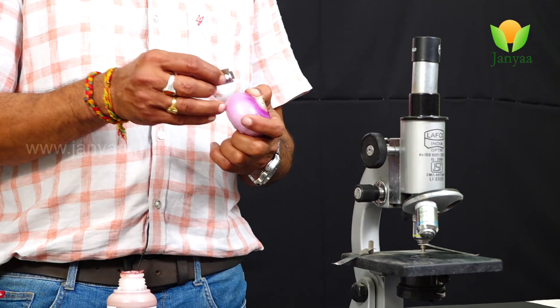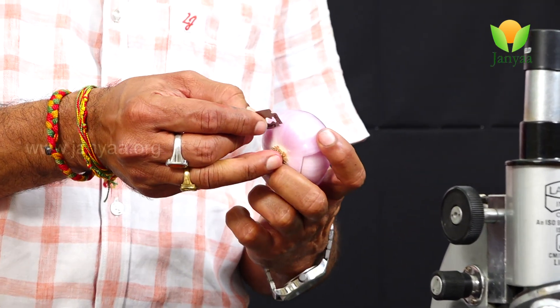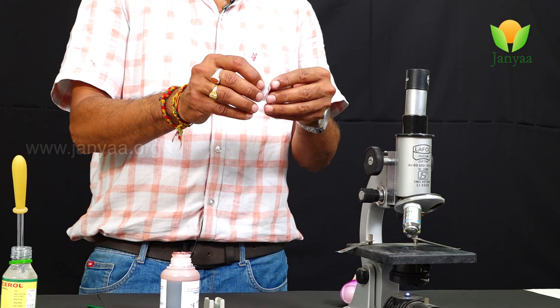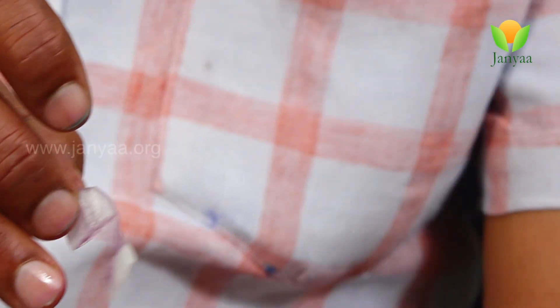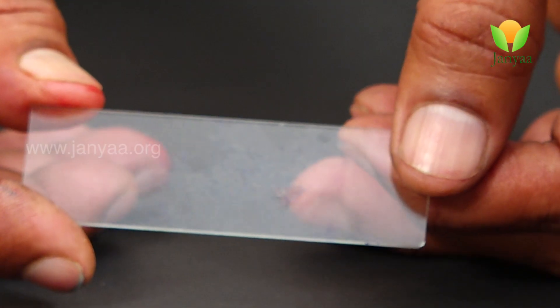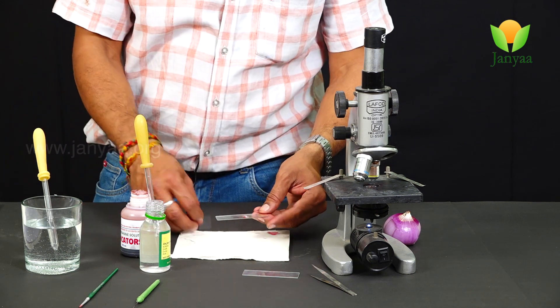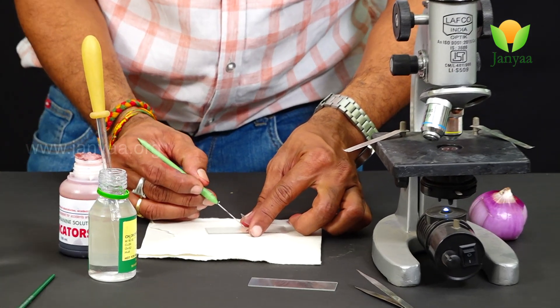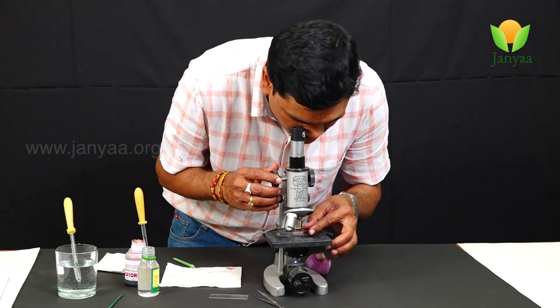Let us do that experiment. Take an onion and take a fleshy layer from it. Bend it like this, then separate the two pieces — you get a thin layer. Now keep it on a slide. Put a drop of glycerol on the onion peel, then cover it with a cover slip to prevent the slide section from drying up. That's why we use glycerol. Now observe it under the microscope.